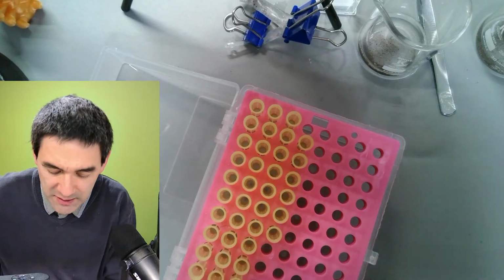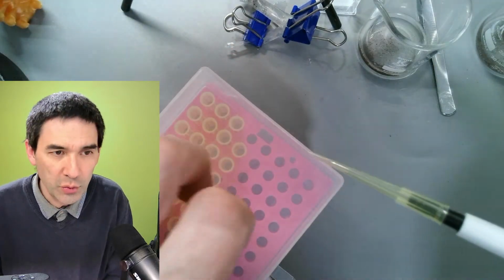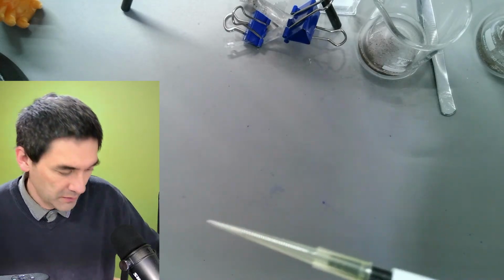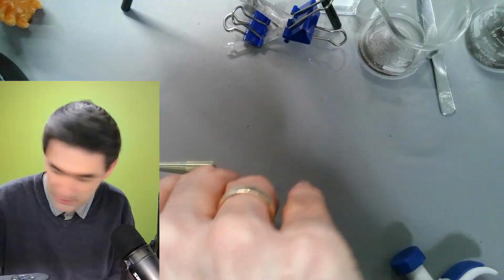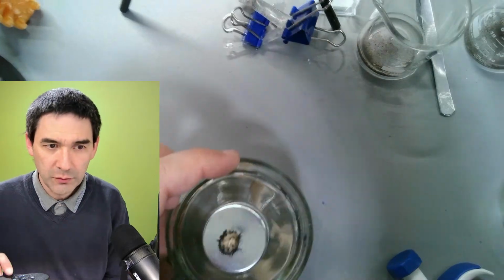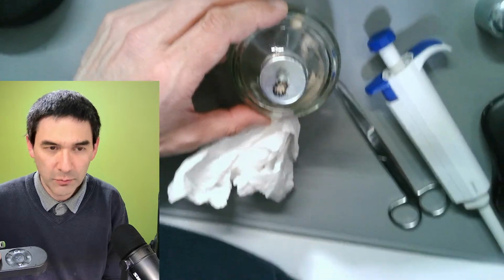And the question now is how can you make the tip here in front smaller? I'm going to show you a possible method which requires a pretty steady hand, and maybe it's not going to work the first time. What I do now is I need again, look what I've got here. You already know that. This is my alcohol burner, and I just realized that here's the lighter. Again, I have to make sure that this is sufficiently far away so that it does not hurt my camera. So let's move it further. Okay.